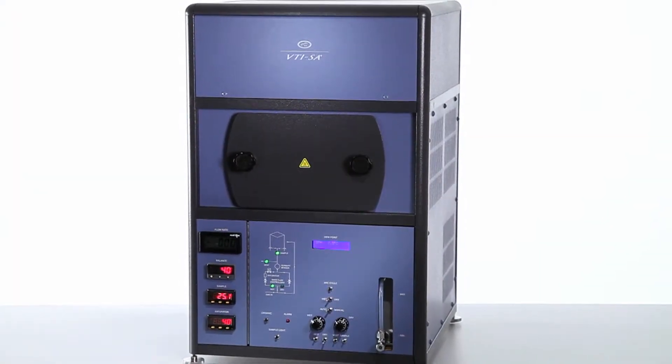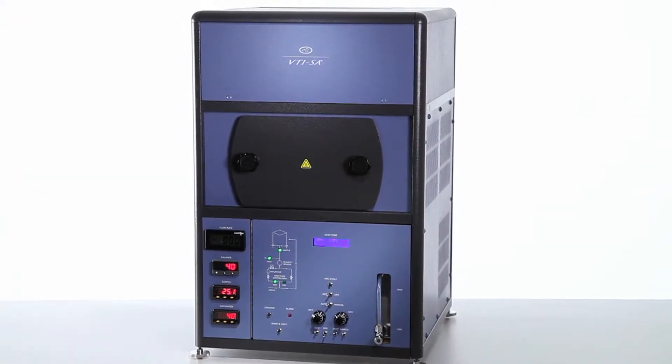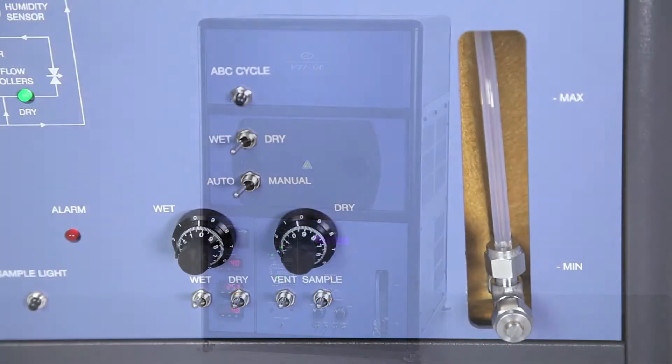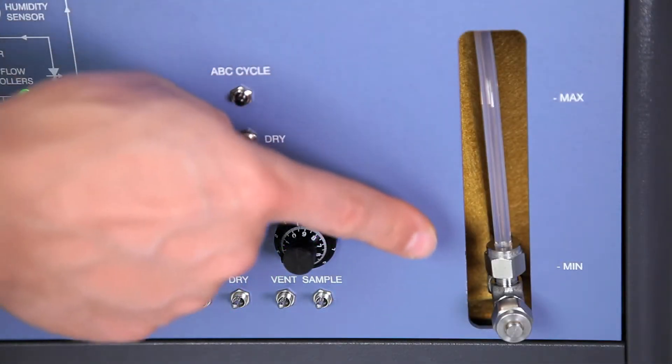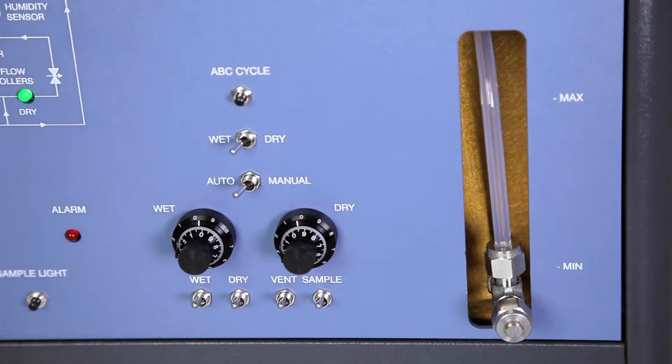Water sorption experiments on the VTI SA-PLUS require refills of water saturator when the water level falls below the minimum level.